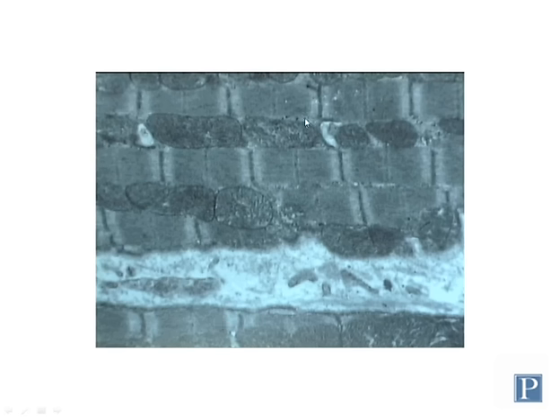And you can see there are alternations of dark and light regions within this electron micrograph. These regions have names that you need to know. These dark bands, which are longer, are called A bands, and the lighter bands, which are shorter, or narrower, are called I bands. So you have an alternation of A bands and I bands.